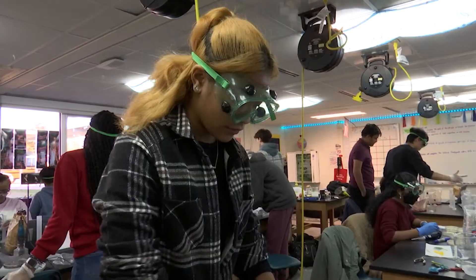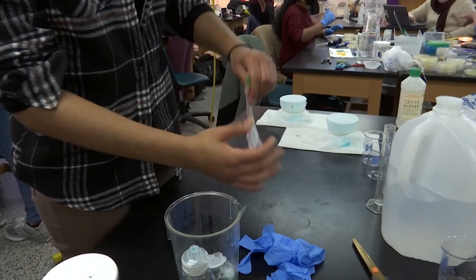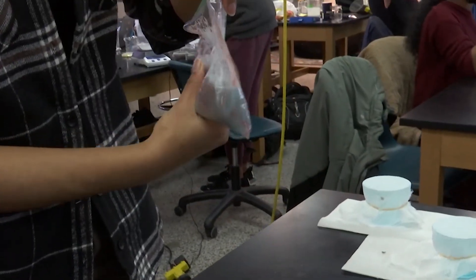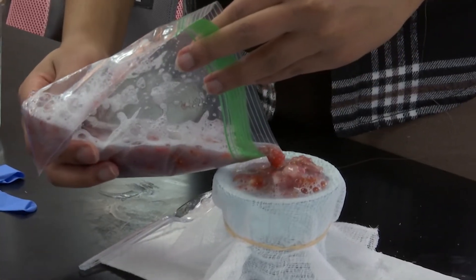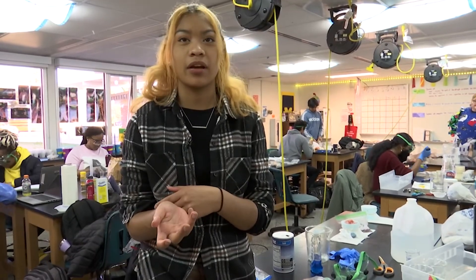I have 40 different senior students, and with that I have 40 very unique experiments going on. My experiment is on DNA extraction from strawberries. The blue solution I had was the extracting solution, so I put it into mushed up strawberries. Basically what I'm testing is how different levels of alcohol affect the measurements of DNA from the strawberry.